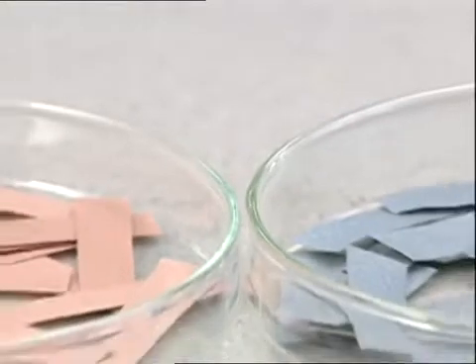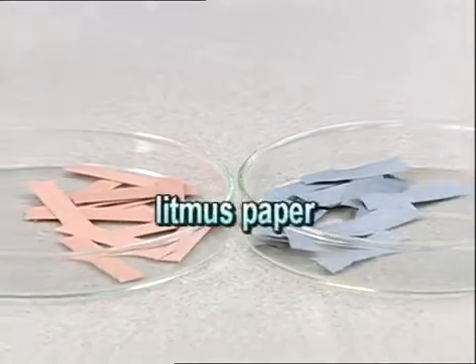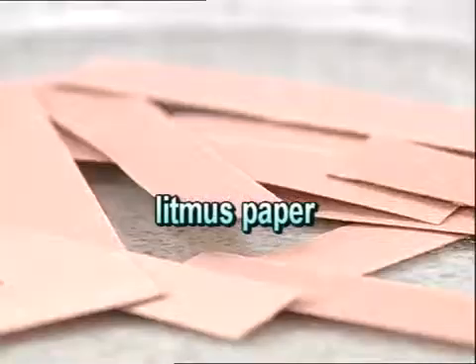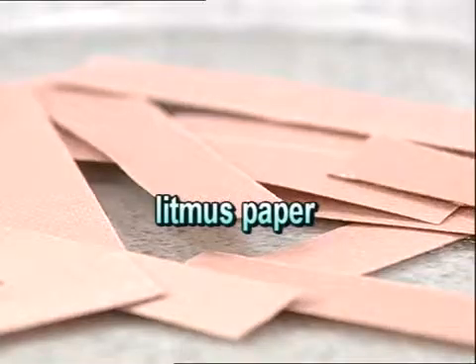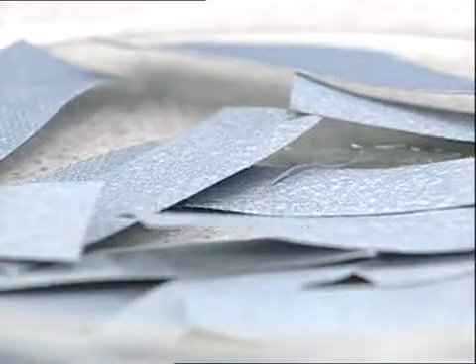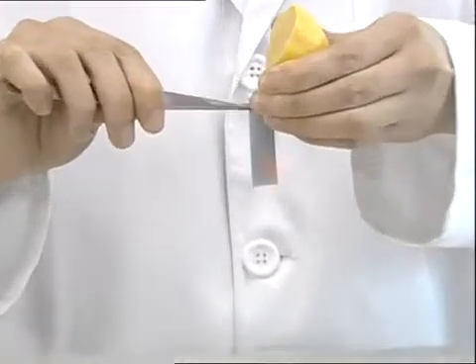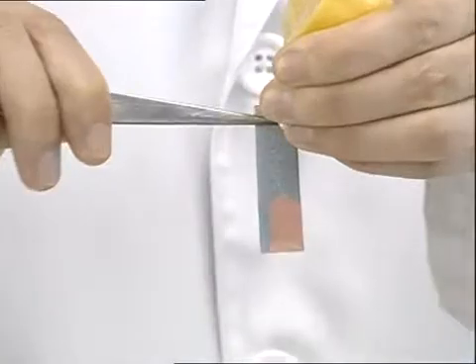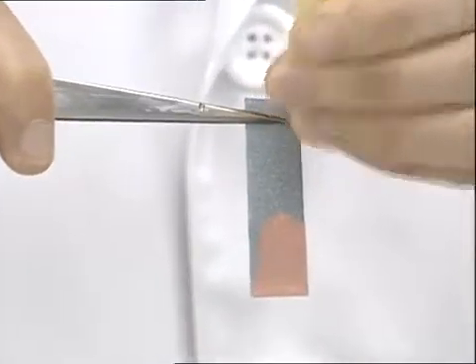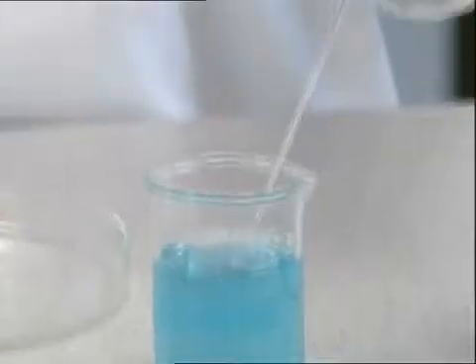The simplest way is to use litmus paper. There are two kinds: red and blue. Acidic materials turn blue litmus paper red. Alkaline materials turn red litmus paper blue.